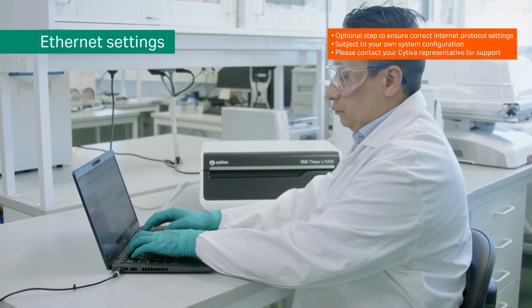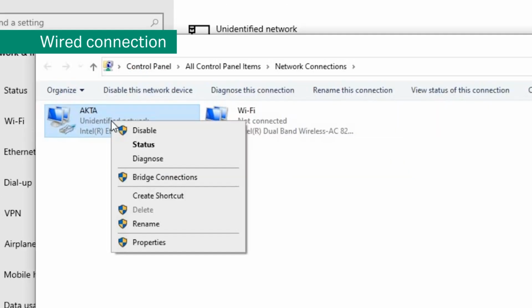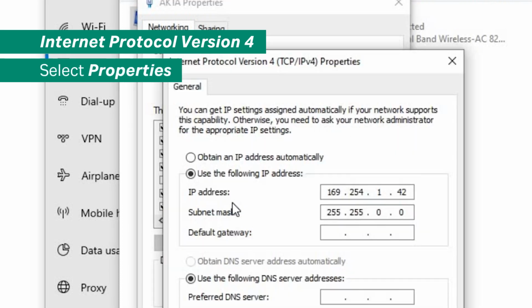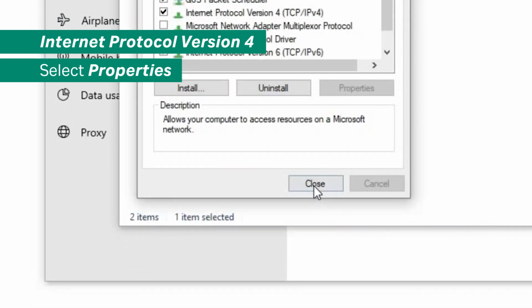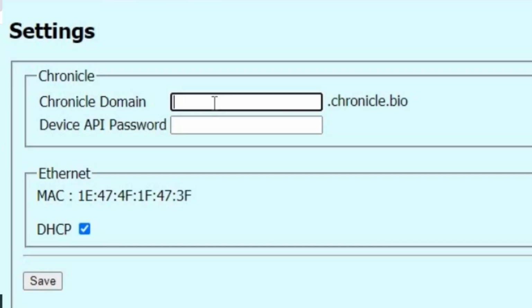Go into the Ethernet settings panel in your laptop. Click Change Adapter Options. Choose the wired connection and enter the Properties menu. Here, choose the Internet Protocol version 4, select Properties, and ensure the Use the following IP address and subnet mask box is checked. Click OK, close the menu, and open a web browser. In the web browser, type in the IP address 169.254.1.1 and click Enter.